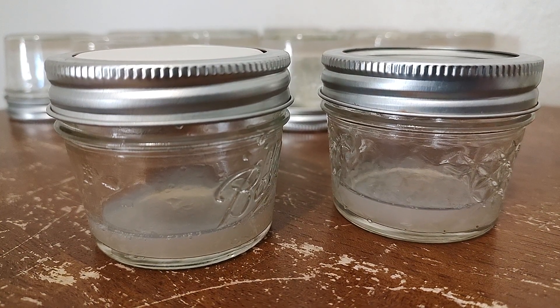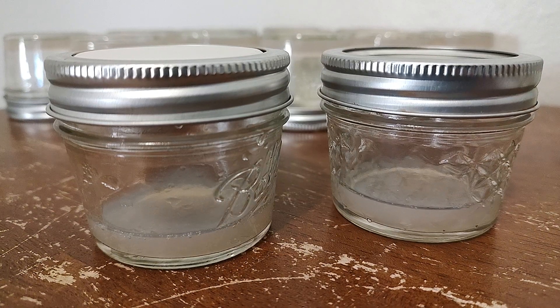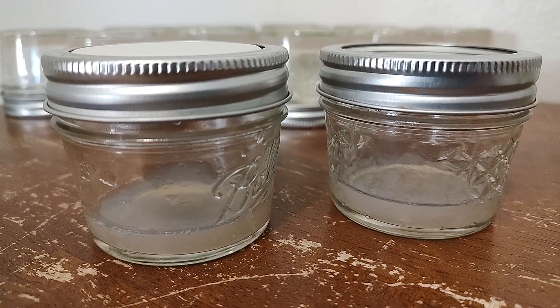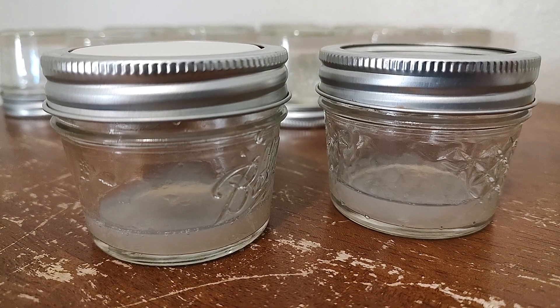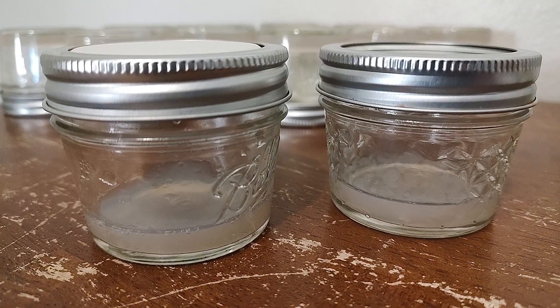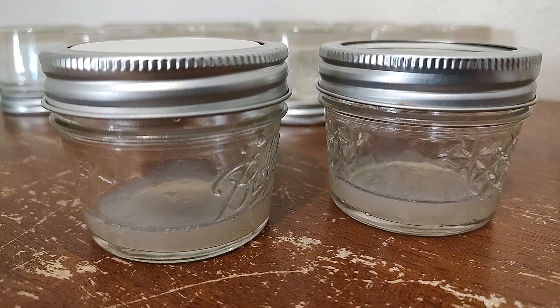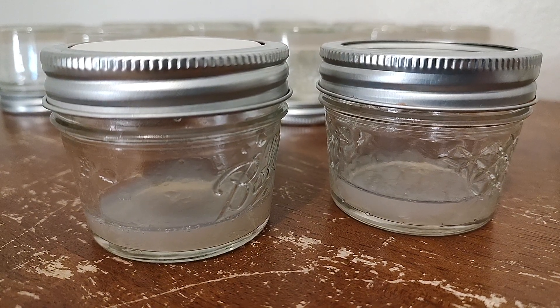The idea is that we created a very light MEA recipe and we use that for the cloning and the first transfer — that's the one here on the right — and then the husband created 12 more of our regular MEA recipe.